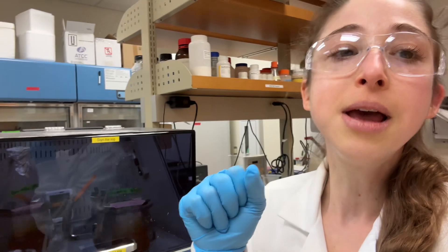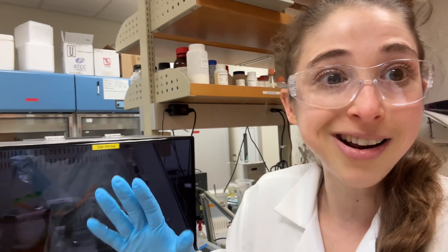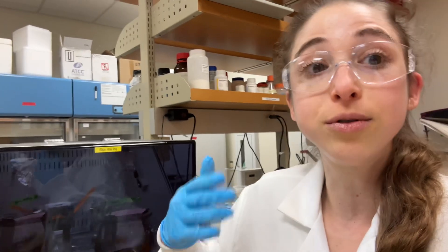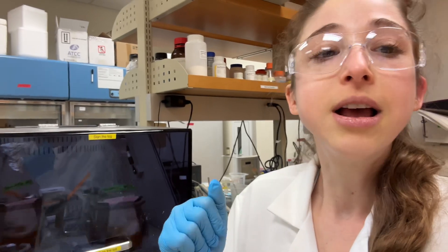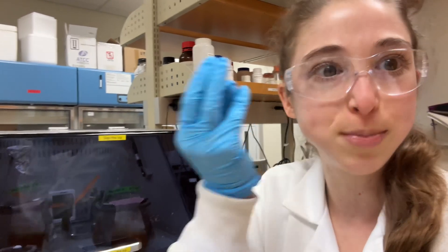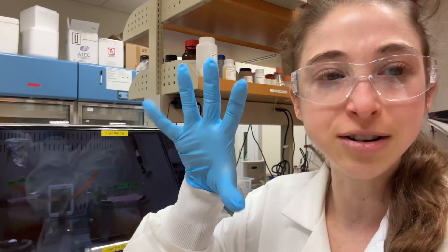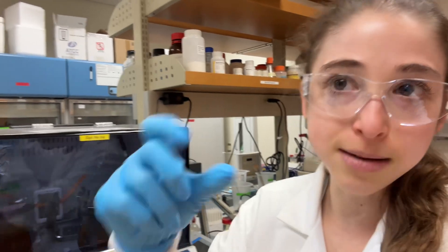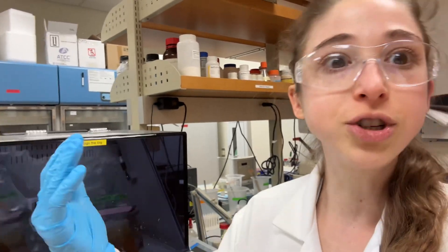You don't want to induce too soon, because you want enough bacteria. When you tell them to make the protein, they're going to stop growing and dividing and just make oodles and oodles of your protein. So you want oodles of bacteria to make oodles of protein, but not so many that they're dead. You have to monitor the OD600 — basically how turbid it is, which measures how much bacteria are in there, because the more bacteria, the less light gets through. So you have to wait, monitor, take samples, measure OD, then add IPTG at the right time and hope you don't overshoot.